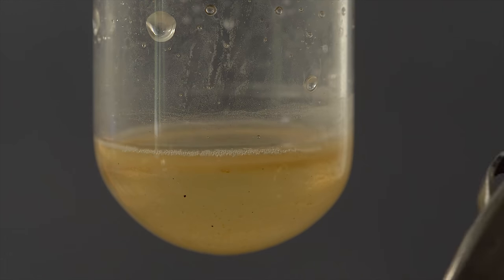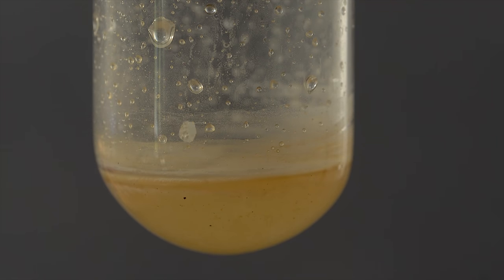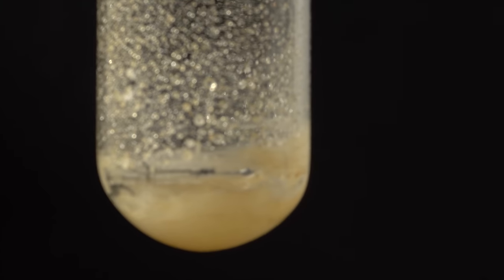However, less light during the operation means pure white phosphorus, and you can see its drops settle on the test tube walls.